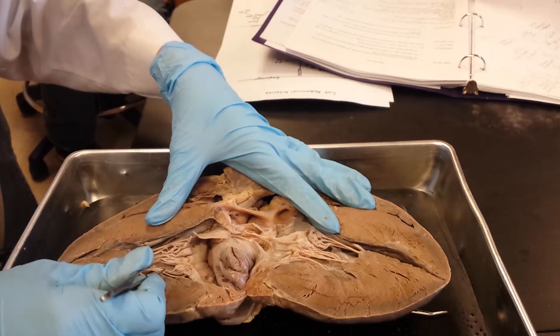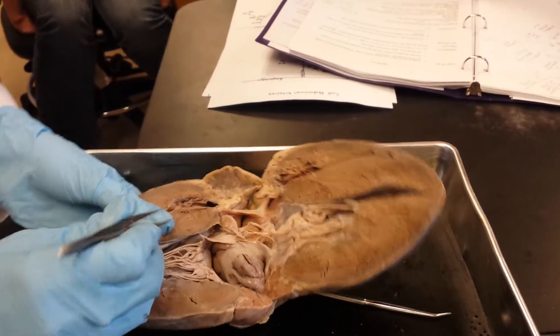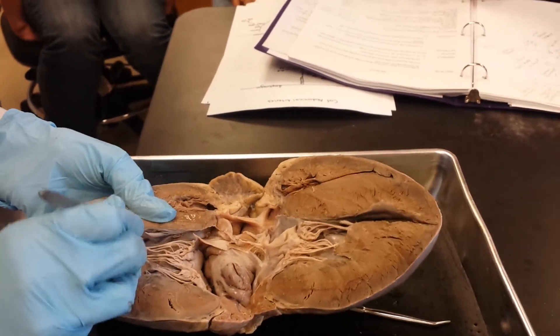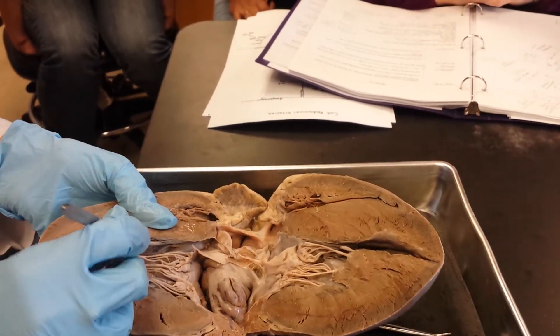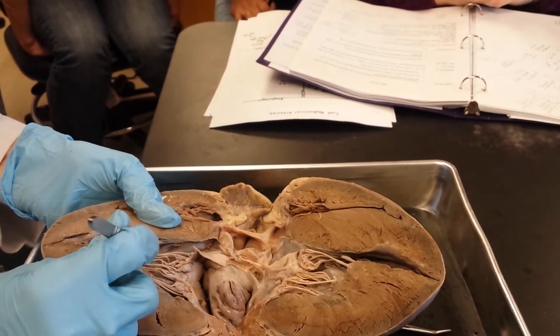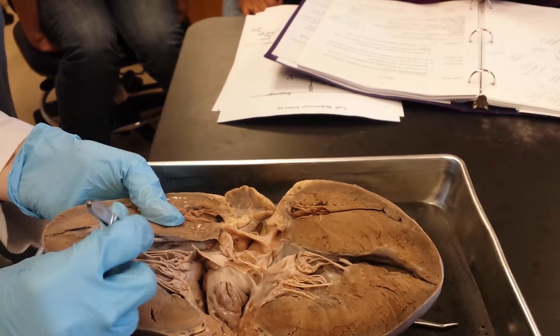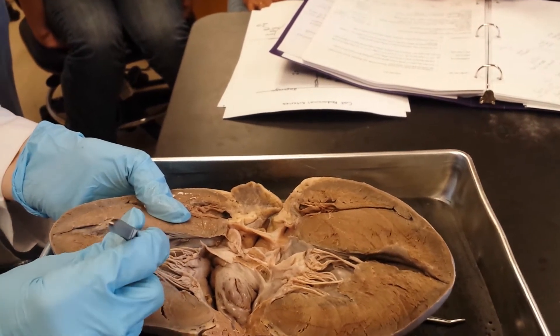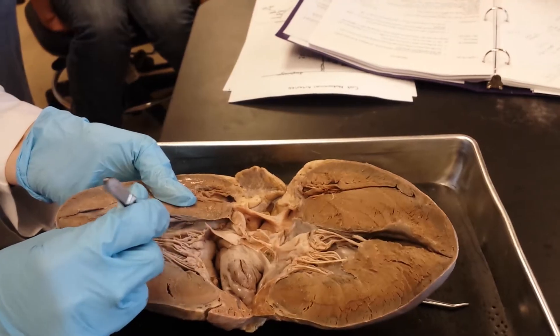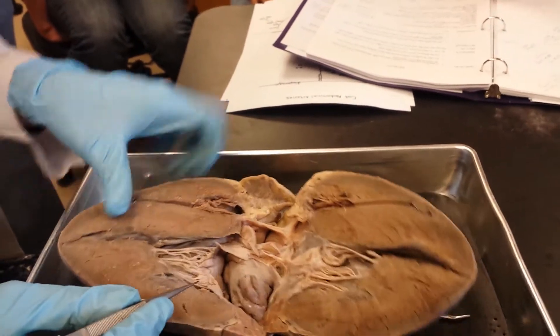Some other things that you can see: in the ventricles you have these ridges, these deep ridges, and those are called trabeculae carneae. Trabeculae carneae is fine — however you need to remember it to spell it.